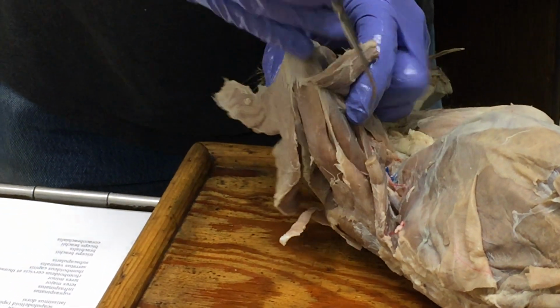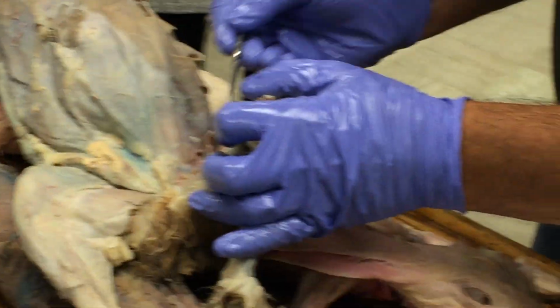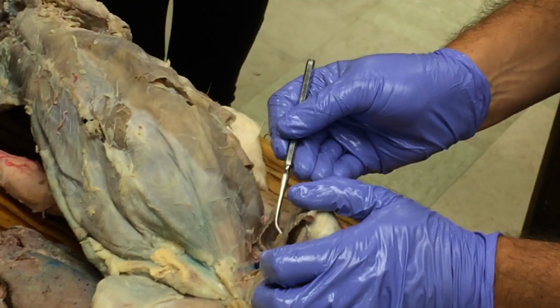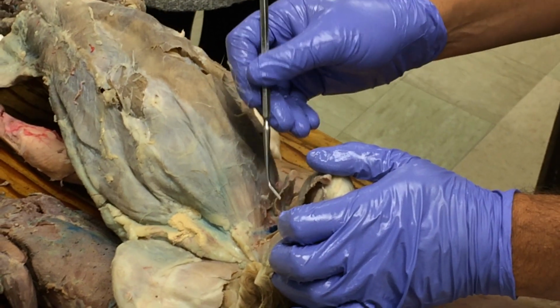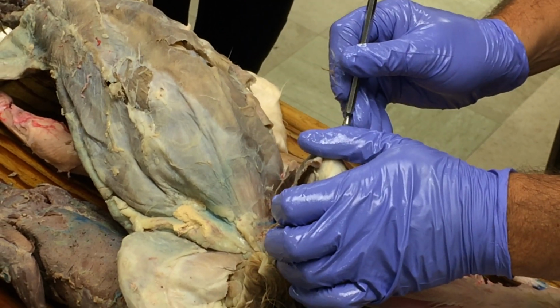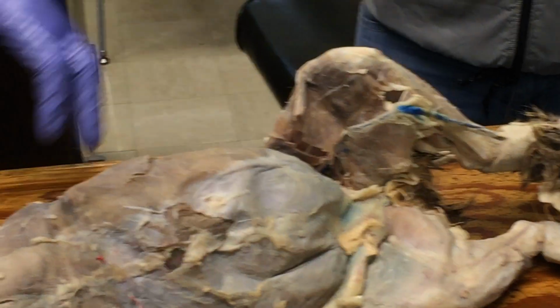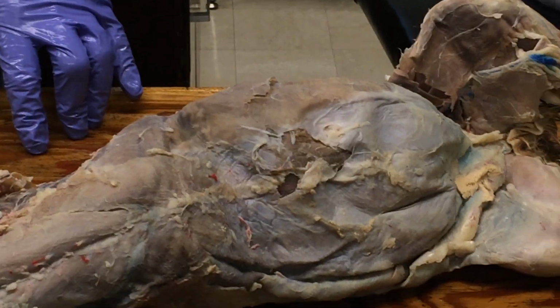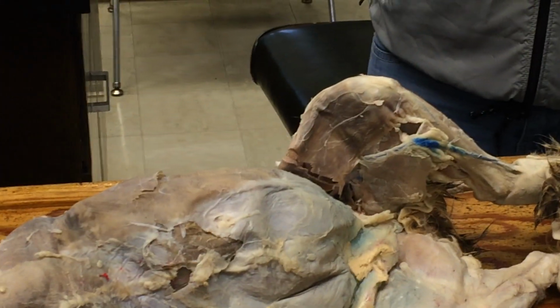Okay, and I'm going to show you guys. I know nobody over there can see that at all. So here's vastus medialis, that's rectus femoris, that's vastus intermedius. And it's kind of sandwiched deep to rectus femoris between vastus medialis and vastus lateralis. Okay. Wait, sandwich between what? It's basically between the vastus medialis and vastus lateralis and deep to or underneath the rectus femoris. Okay. So let's look at the mink.